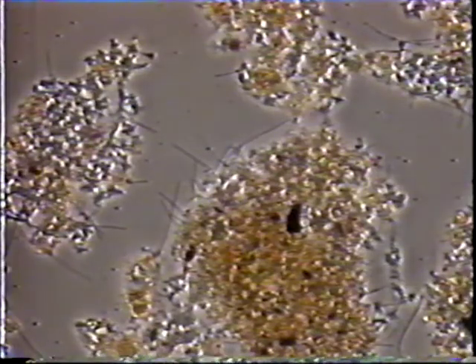Beggiatoa is the only filament that moves, shown here at 100 power, going between the floc. This mobility is the key identification characteristic for Beggiatoa. This filament usually has sulfur granules in the cells, shown here. It has rectangular-shaped cells, however, these cells are usually masked by sulfur. It is Gram-negative and Neisser-negative.